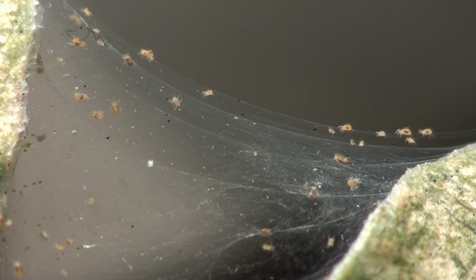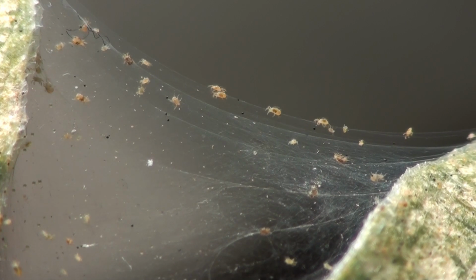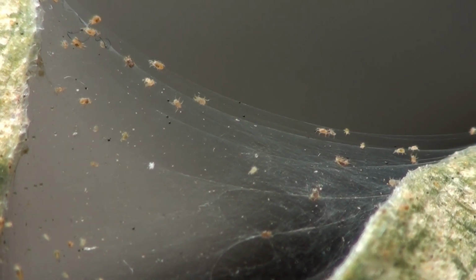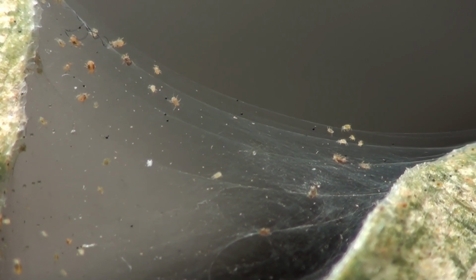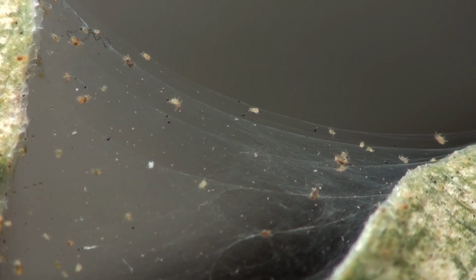But let's look at some Spidermites. So here you can see the Spidermites in action. Essentially, they do all look like little small spiders. That's the web that you're seeing that they usually will cast across the leaves, and it's usually by that point, if you're seeing a lot of webbing, you've already got a pretty heavy infestation.